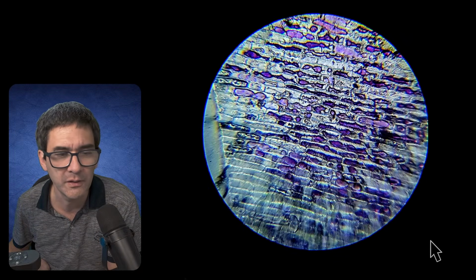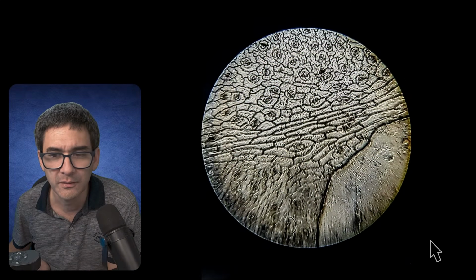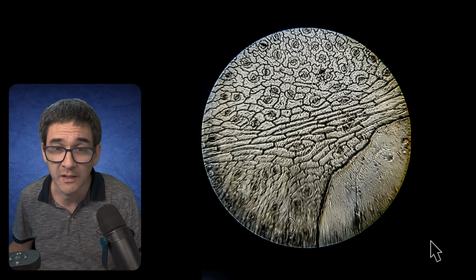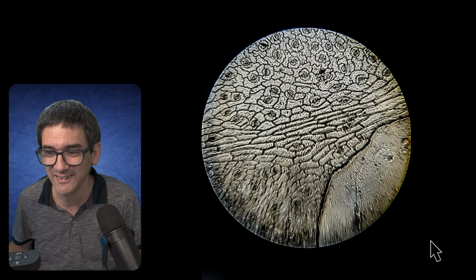We're talking about surprisingly good quality, considering it's not such an expensive microscope. So basically, take-home message, also something that I did not expect: exchange the eyepieces. Get yourself a better eyepiece.